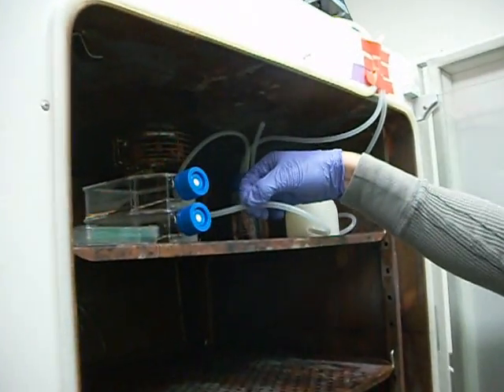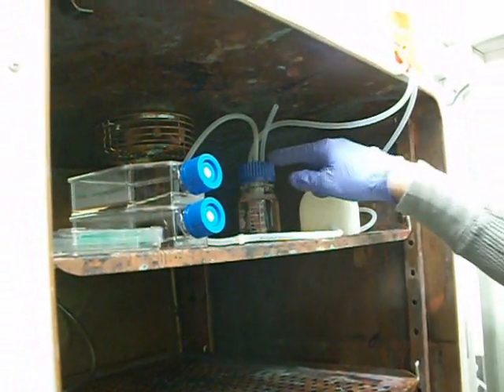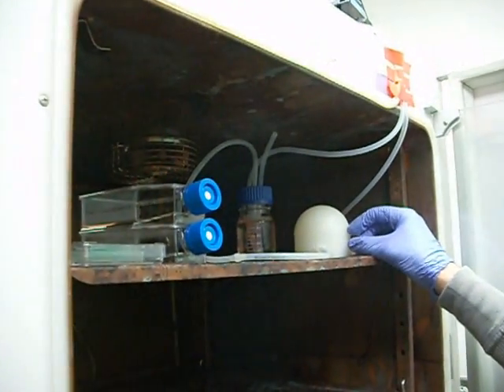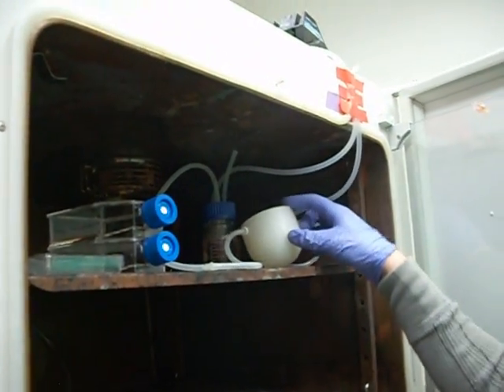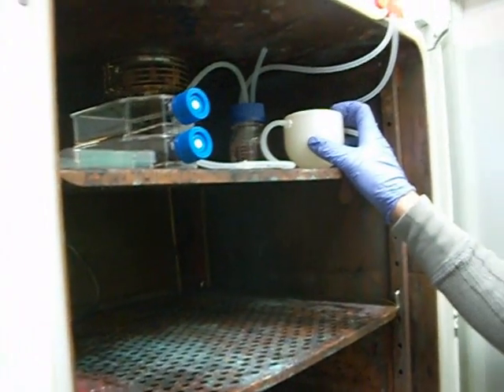And this is where we'll end up putting the flow chamber. So now we're going to go ahead and turn on the pump so that it pumps the fluid out through the pump and into the pulse dampener to fill up the pulse dampener. I'm just going to go ahead and fill up the pulse dampener with about 60 mils or so of media.